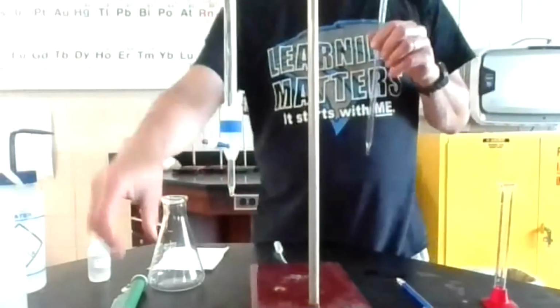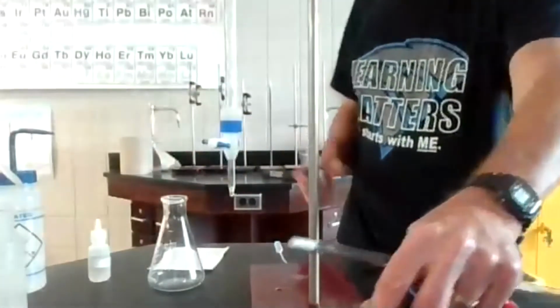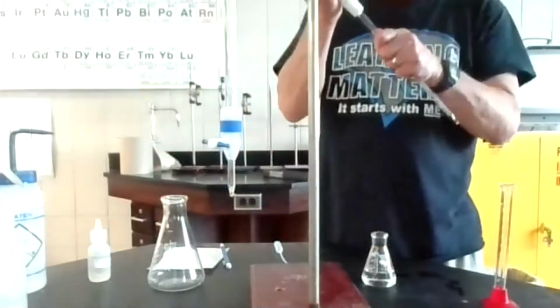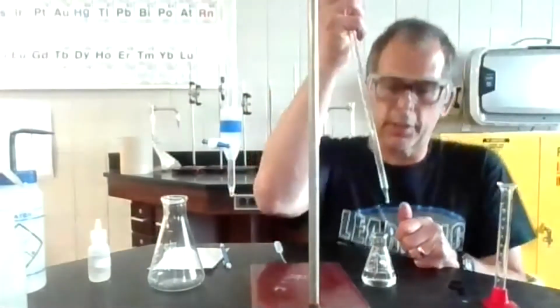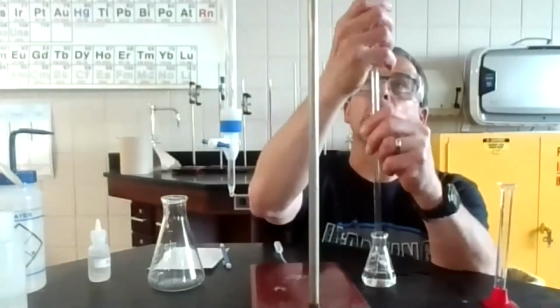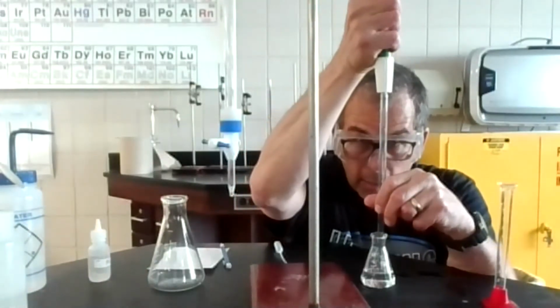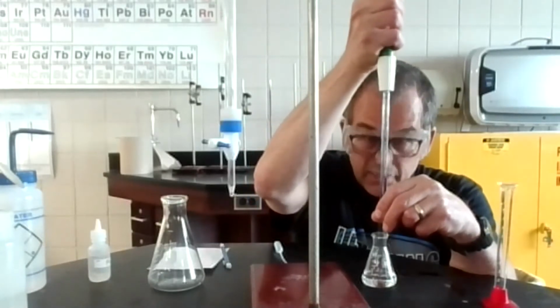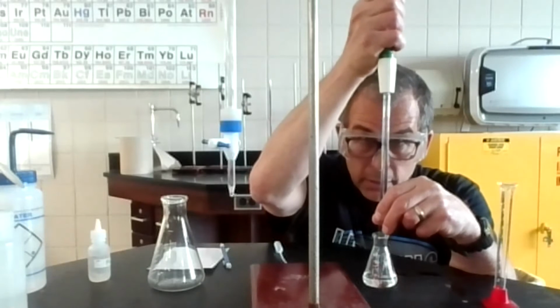And then I'm going to go do that with mine right there. So you don't really even have to rinse it because it was already open. And then what I'm going to do is put this pipette bulb on, and I'm going to get my 10 milliliters because that's what I chose to do. And I'm going to put this in, draw up to the 10 milliliter mark, or actually a little bit past the 0 because it goes in the other direction.